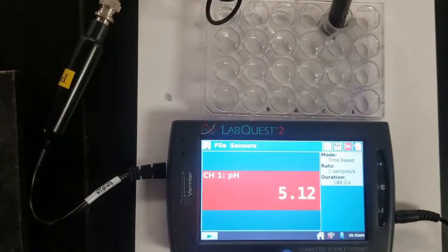And then wait for it to stabilize. And so you can tell it's giving us a pH of 5.12, which agrees well with what we found out from our indicators. And so it's just another way to do it, right? Old school way, new school way, both have advantages and disadvantages, right? You think the technology is better, but really the disadvantages are cost. And technology is great when it works, but we all know it has a way of not working right when you need it. All right, so move on to the next step.